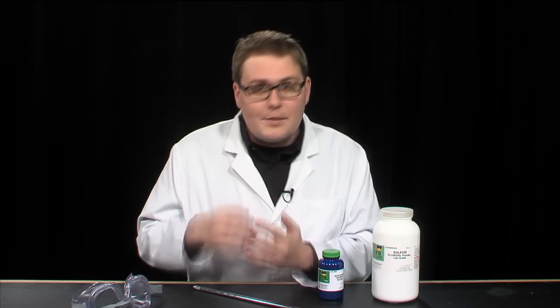But first, we need a catalyst. Now just what is a catalyst, you might ask? Well, to put it simply, it's any substance or material that initiates a chemical reaction. For this demonstration, an iron rod will do just fine. However, there is one quick thing we need to get to first.